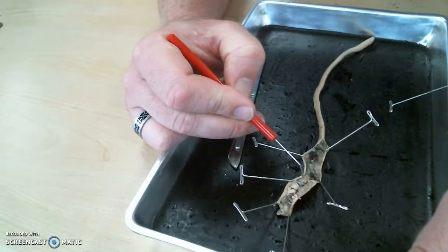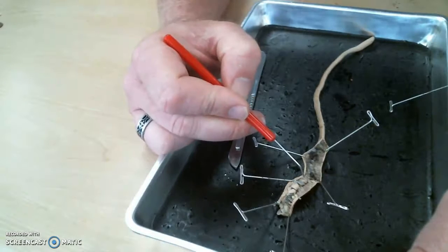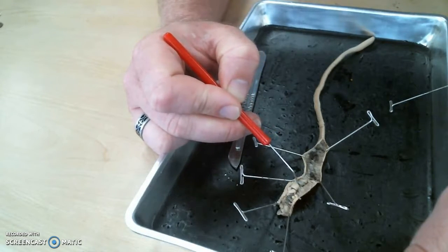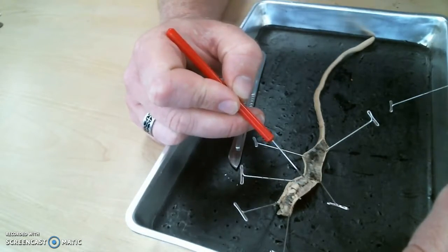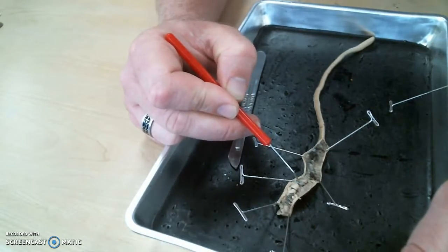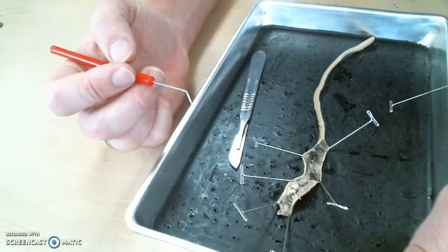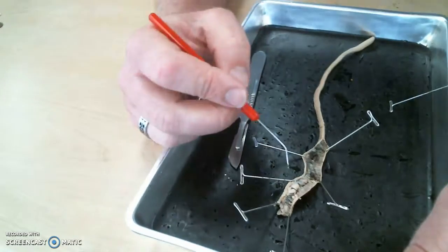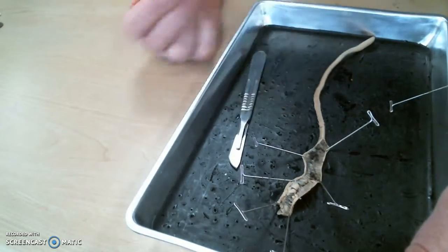These two structures, there's a less muscular portion of it and a more muscular portion of it. Together, they make up sort of the stomach. But the stomach of the worm is in two chambers. One is less muscular, one is more muscular. What's the less muscular one called? The crop. Good. And the more muscular one is called the what? The gizzard. Good. And then there's a tube that extends after the gizzard and runs the rest of the length of the worm. What's that tube?